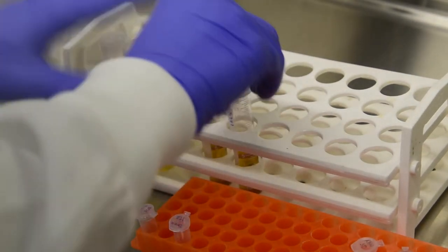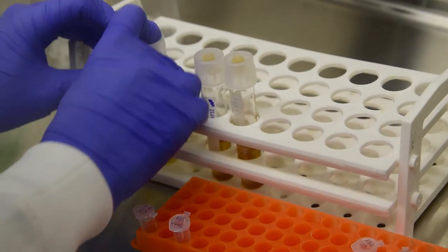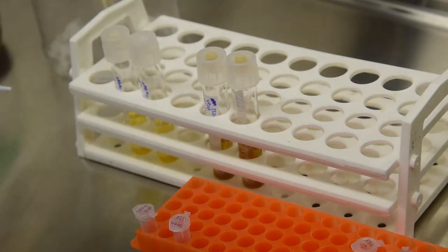Cap your tubes and give them a brief shake, before placing them in the incubator for 48 hours at 28 C and a rotational speed of 225 RPM.